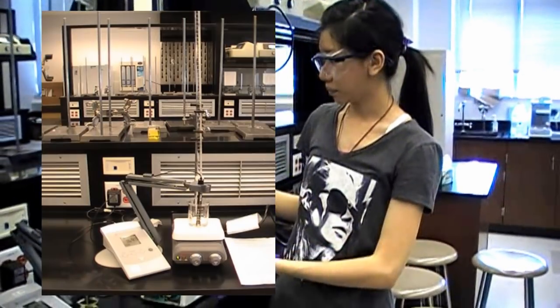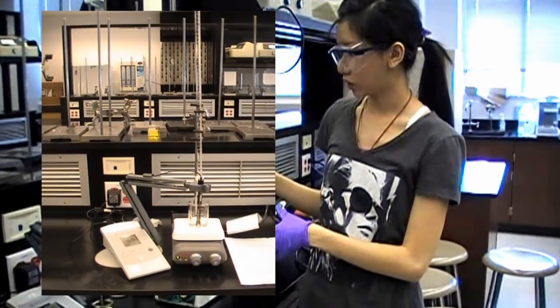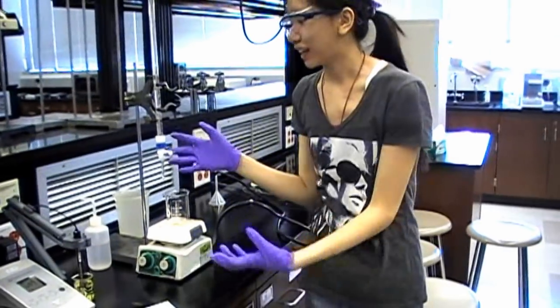This is the best setup you should use for the experiment so that you won't accidentally break anything.